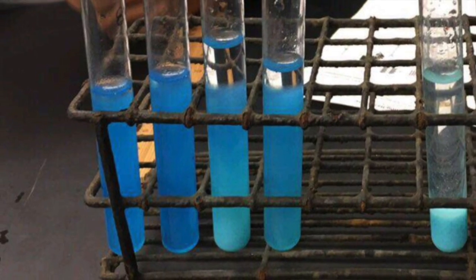Our group's precipitation measurements were 2 millimeters, 4 millimeters, 7 millimeters, 15 millimeters, 23 millimeters, 23 millimeters, 28 millimeters, and 28 millimeters. We concluded that CuSO4 was the limiting reactant only because it was put in each of the 8 test tubes and was overpassed by the excess of potassium hydroxide, which explains why there is not any more precipitation happening. The precipitate in the lab was Cu(OH)2 when we combined the reactants together.